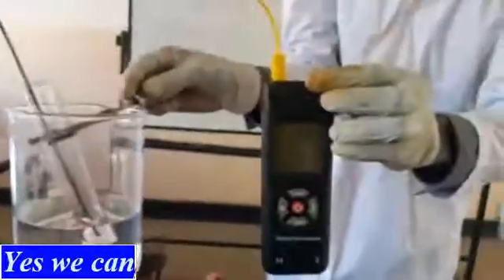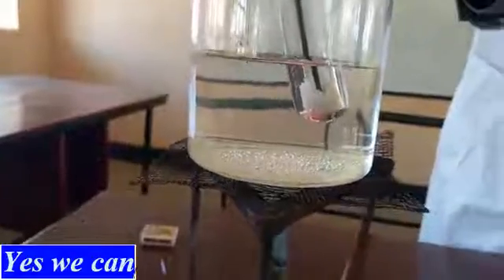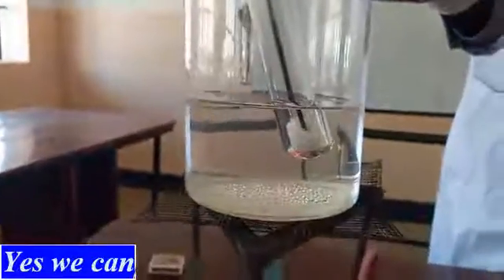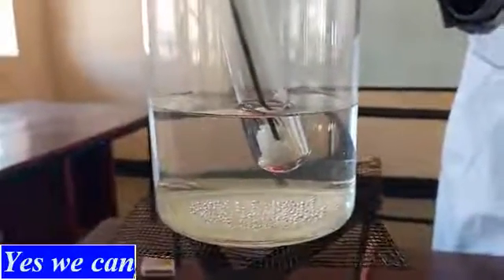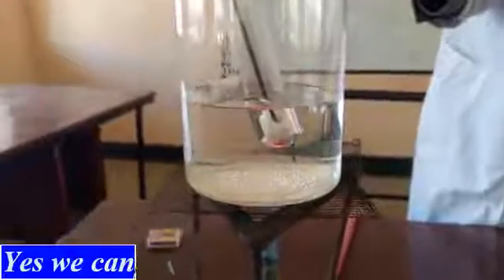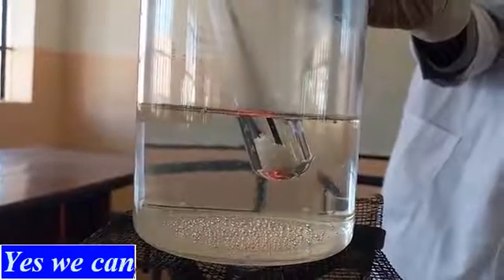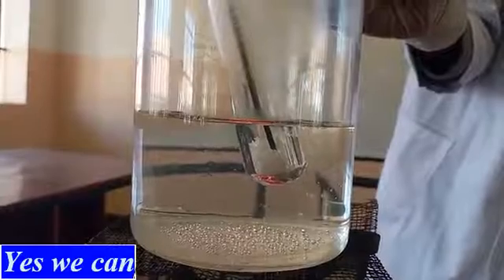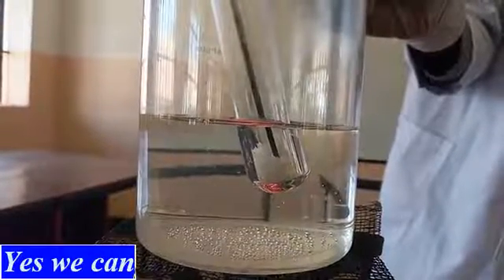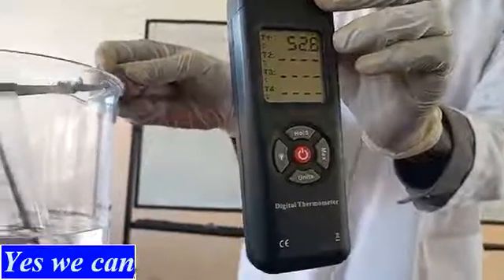Make sure you notice carefully at what point it just starts melting and note the temperature. The naphthalene has not started melting yet, so we have to keep waiting and be patient. Naphthalene is an organic compound, which may be new to you, but we are using it because it is also a solid. When it starts melting, we know that its melting point is that temperature.